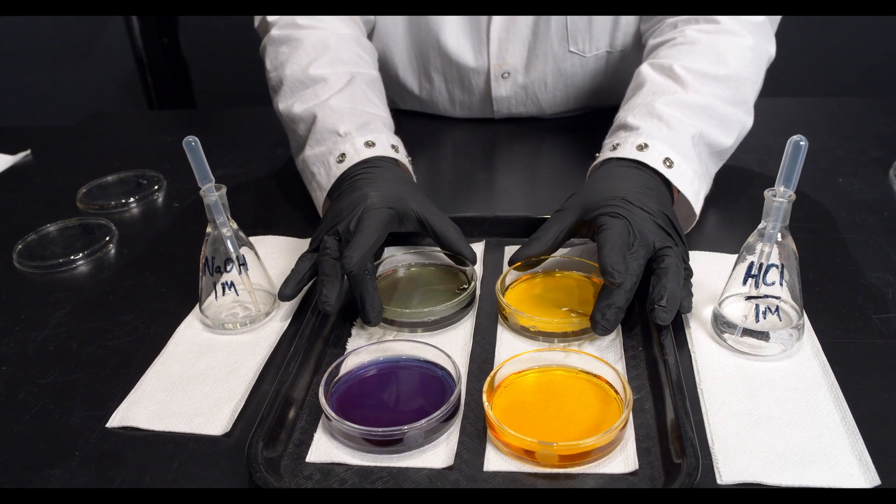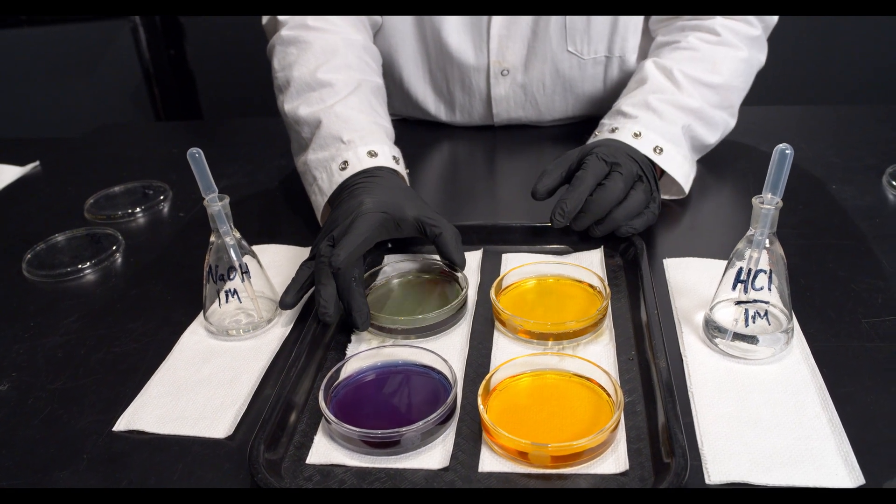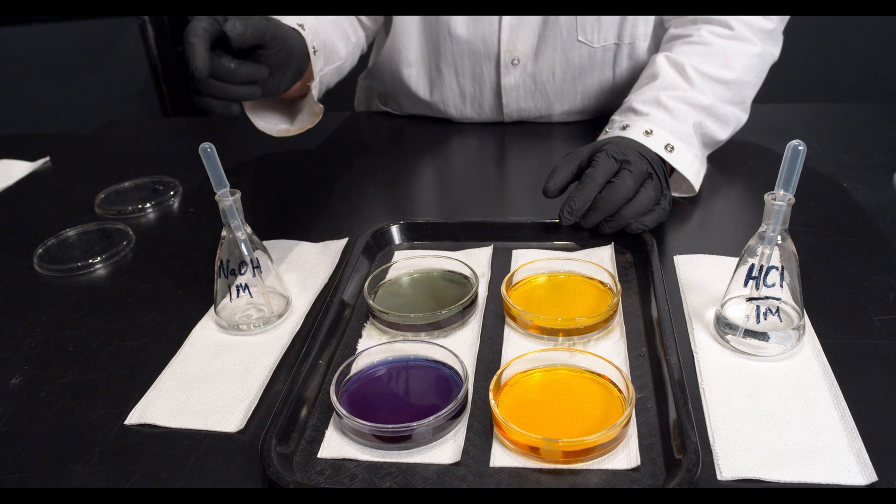Once I exceed the buffering capacity of these mixtures, then as you can see on the acid side, I pushed right past it. On the base side, not so much.